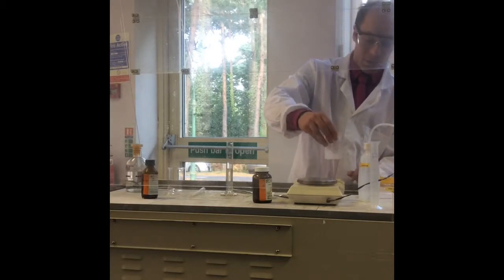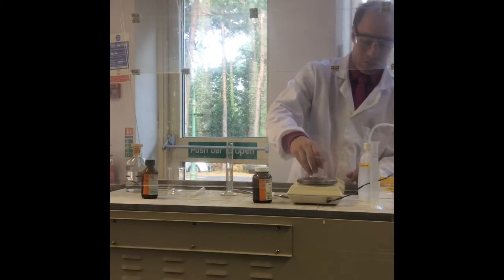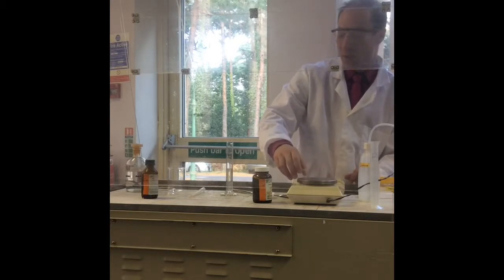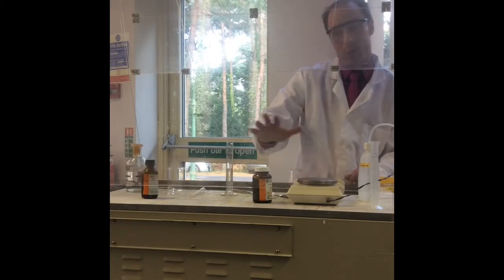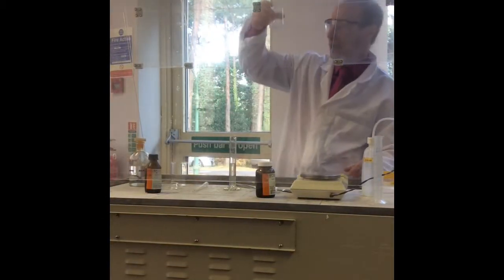So this will mop up any HCl that is produced, and it just has to react, but that needs to dissolve up a little bit. While it's dissolving, do you want to just pause it? That's pretty much dissolved. I've still got a little bit going on, but it's not too bad.